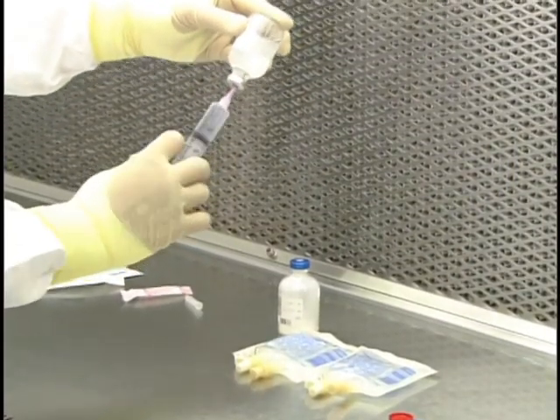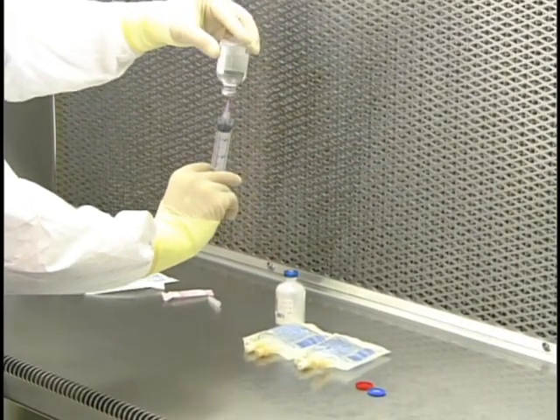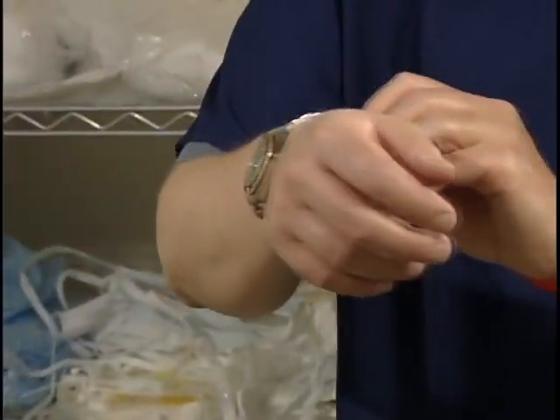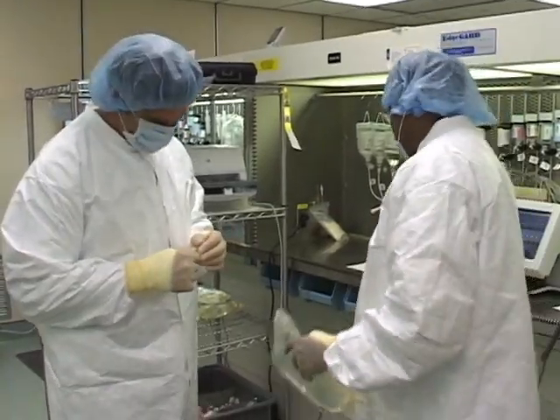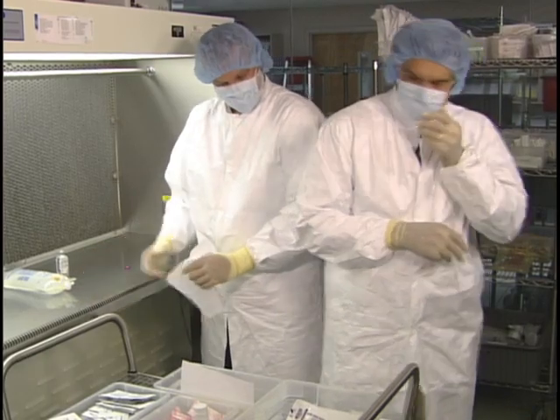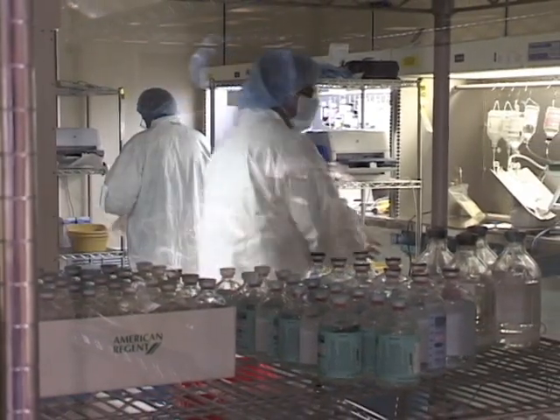Only objects essential to aseptic compounding should be placed in the laminar airflow workbench. Do not put paper, pens, labels, or trays into this area. Jewelry should not be worn when compounding since it can affect the integrity of personnel gowns and gloves and the effectiveness of hand hygiene. Actions such as talking and coughing should be minimized and, when necessary, directed away from the compounding work area. Unnecessary or rapid movement within or around the laminar airflow workbench should be avoided to minimize the turbulence of airflow. Smoking, eating, gum chewing, and drinking are strictly prohibited in the aseptic environment.